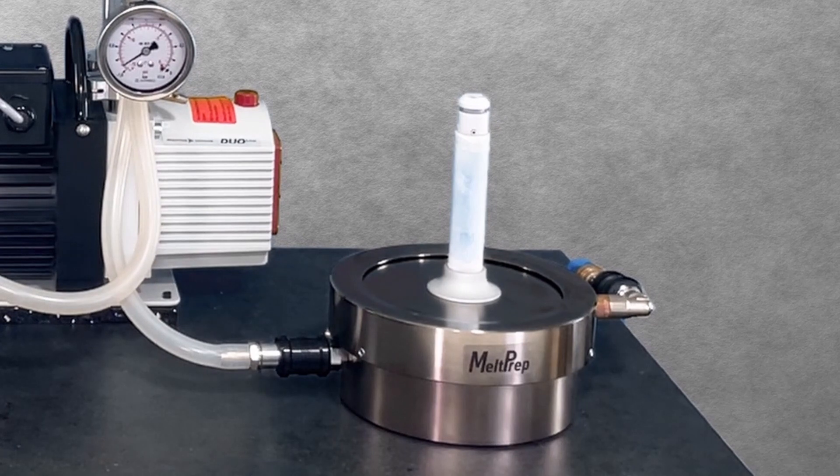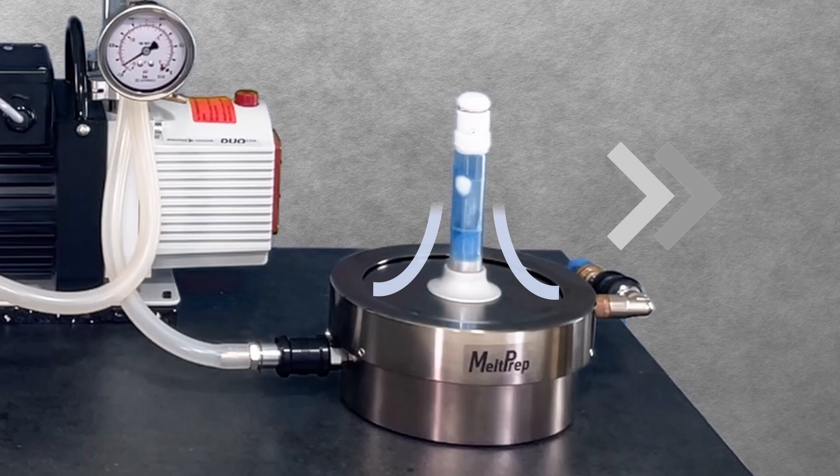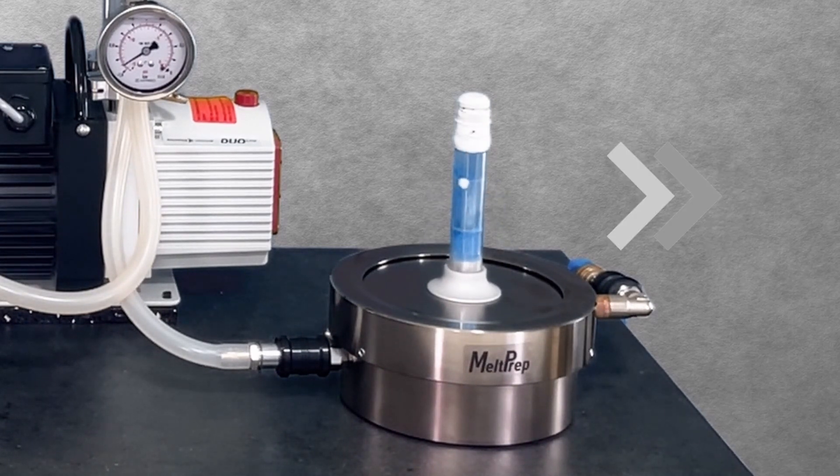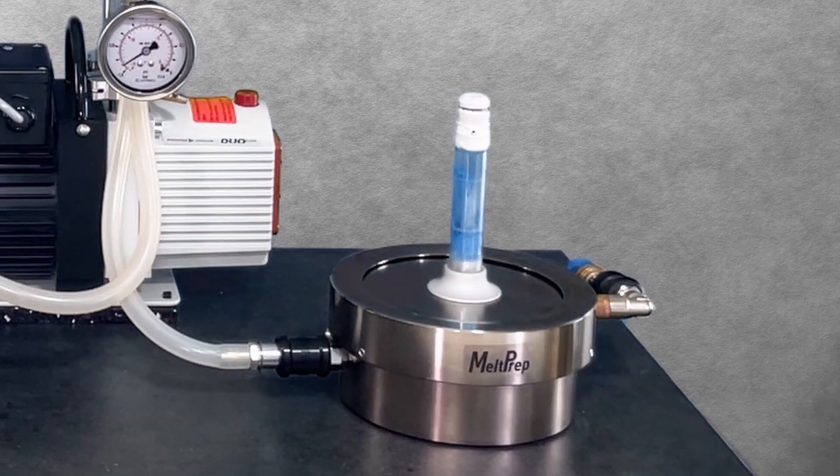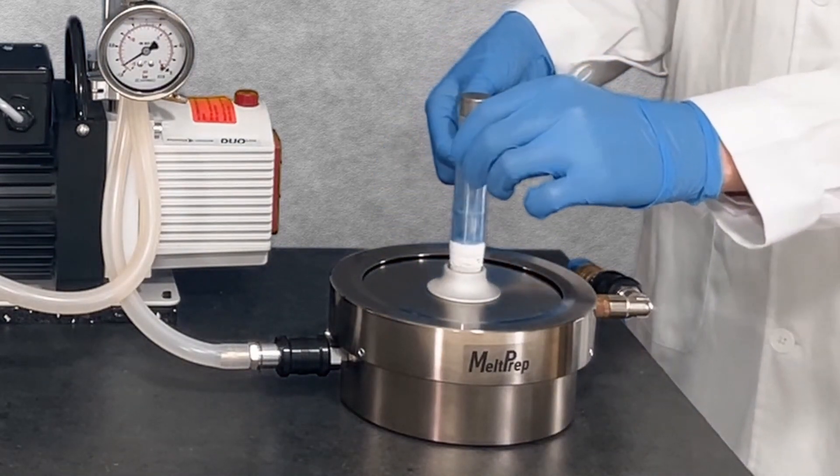The ice will first melt, and the water will dry up quickly. When the lower half is done, flip the milling vial over to unfreeze the upper half.